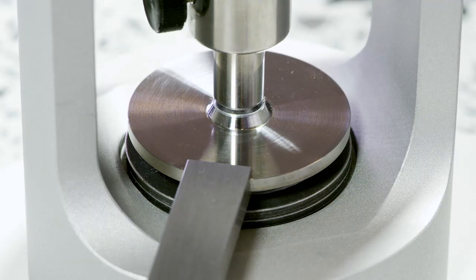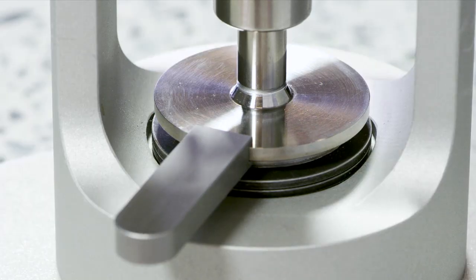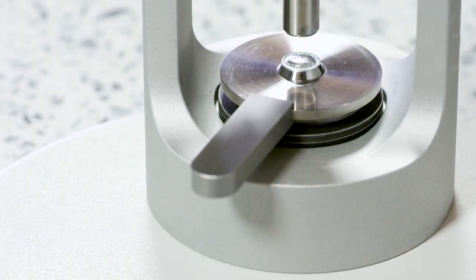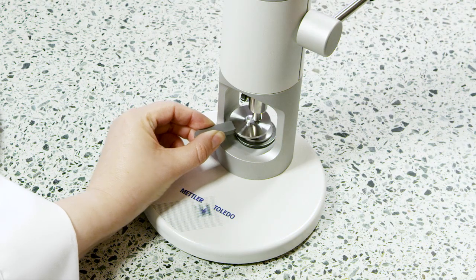Center it and rotate the lever to move the plunger down until its resistance is overcome. The lid is now cold welded to the crucible rim.